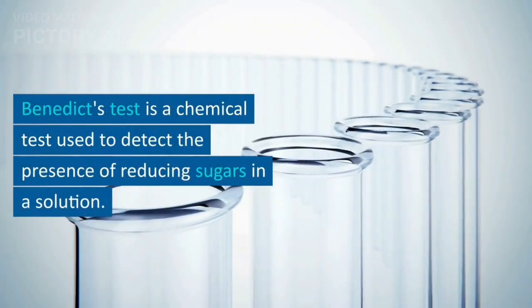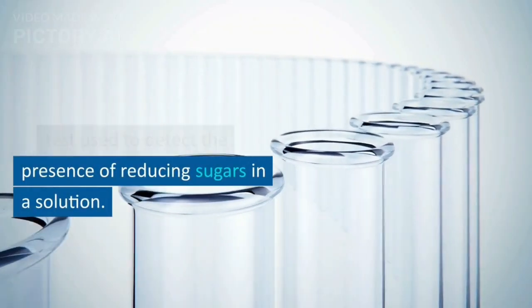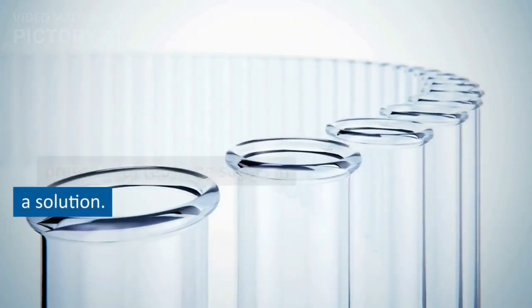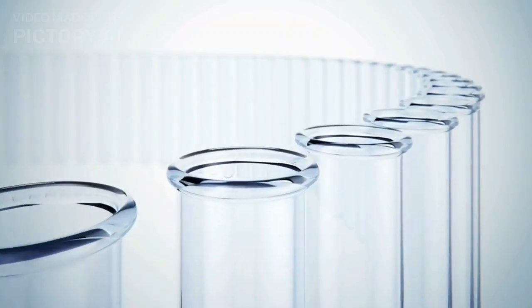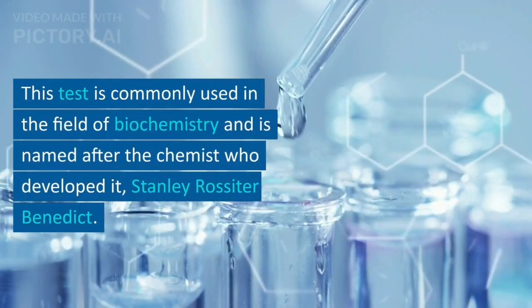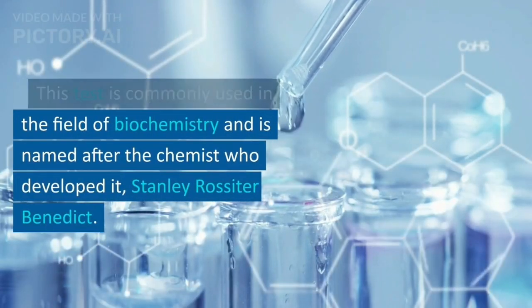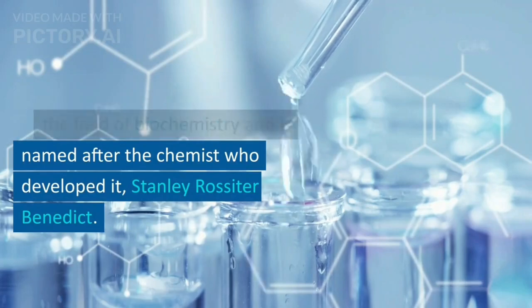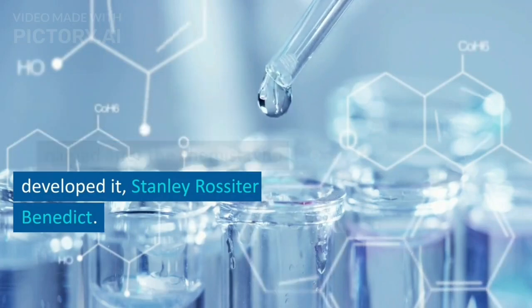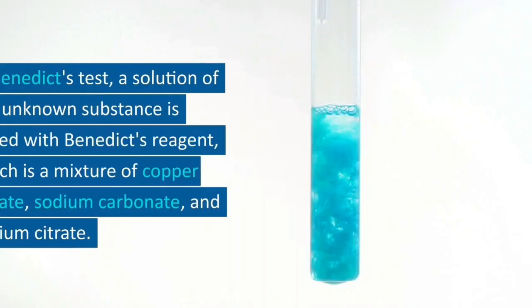Benedict's test is a chemical test used to detect the presence of reducing sugars in a solution. This test is commonly used in the field of biochemistry and is named after the chemist who developed it, Stanley Rossiter Benedict.